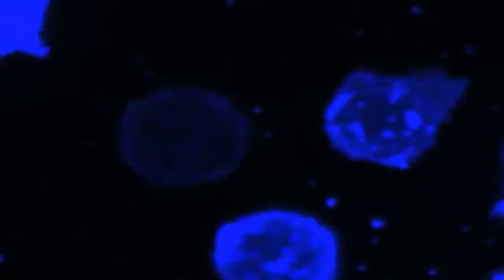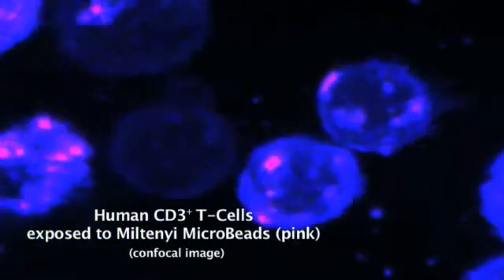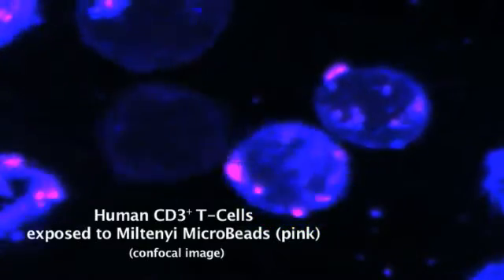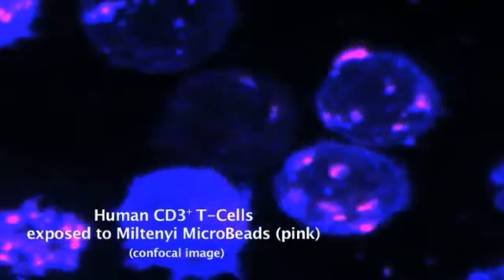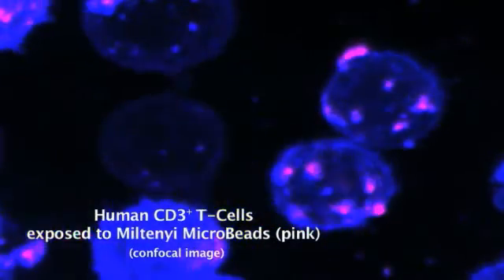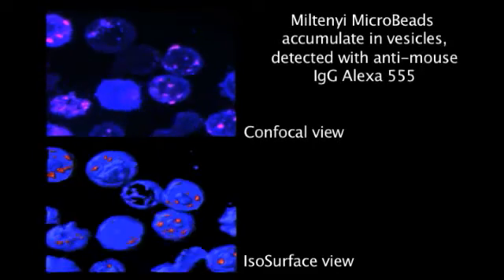Here we see peripheral blood mononuclear cells prior to exposure to Miltenyi human CD3 microbeads. Once the Miltenyi microbeads are added, binding and uptake of the microbeads in pink can be tracked using confocal microscopy. The cells and Miltenyi microbeads can be more easily visualized using isosurface imaging.